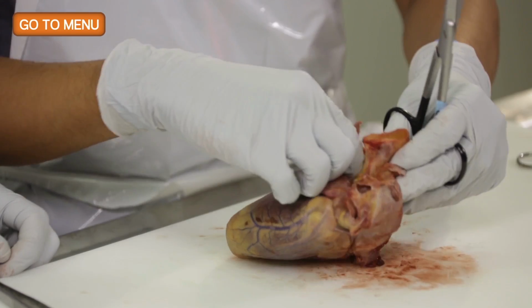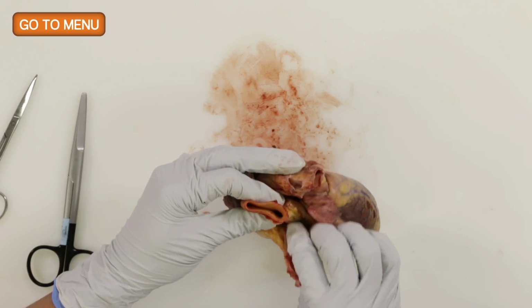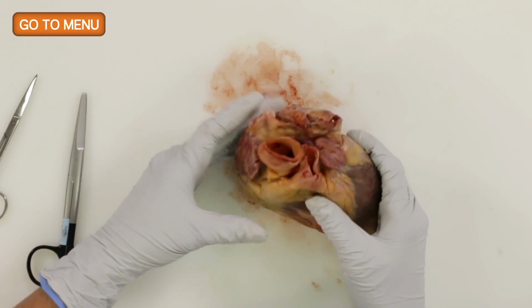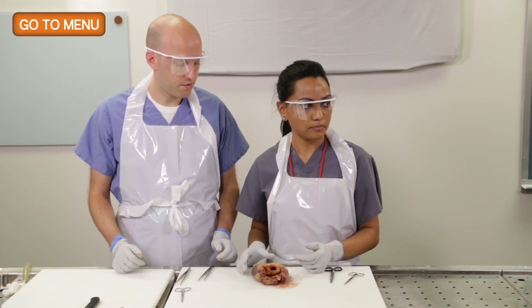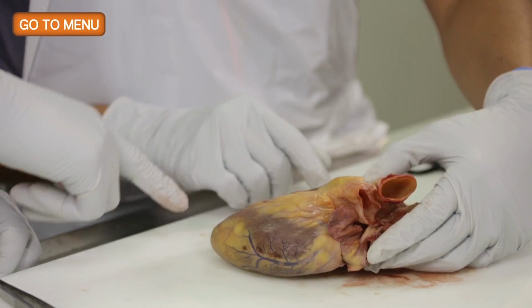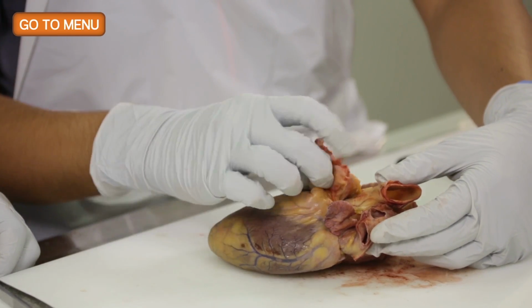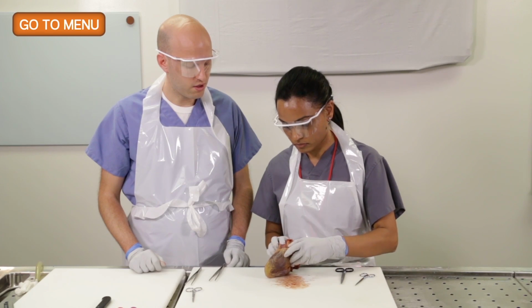All right, so you've reflected the aorta away from the pulmonary artery, or vice versa, and that's something that needs to be done for later on. So the next thing we're going to do is remove the coronary vessels, and generally start on the left, but you can do whichever one you want. You can do it one of two ways. You can start at the end and go up the LAD to where it arises from the aorta, or you could go the opposite direction, and start at the ostia and go distally.